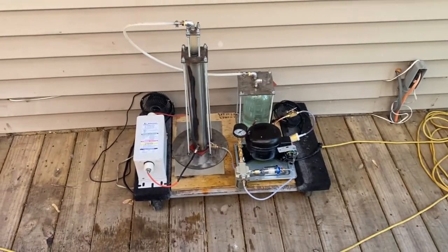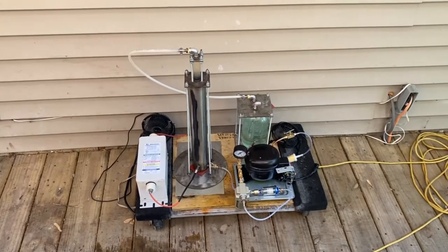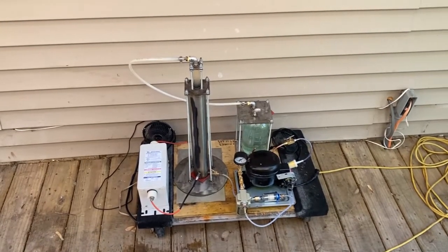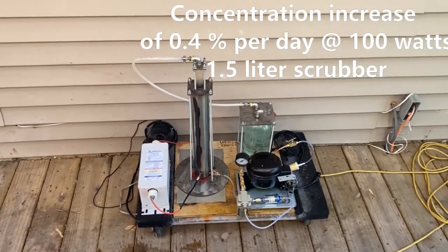Hey, what's up fellas? This is a Birkeland-Eyde reactor that synthesizes nitric acid from air and electricity using a spark gap.